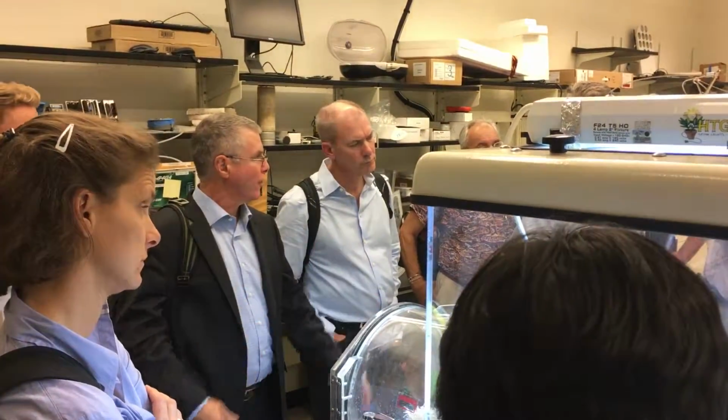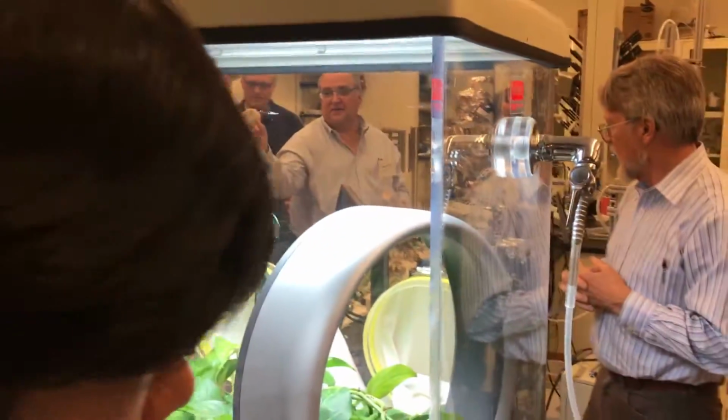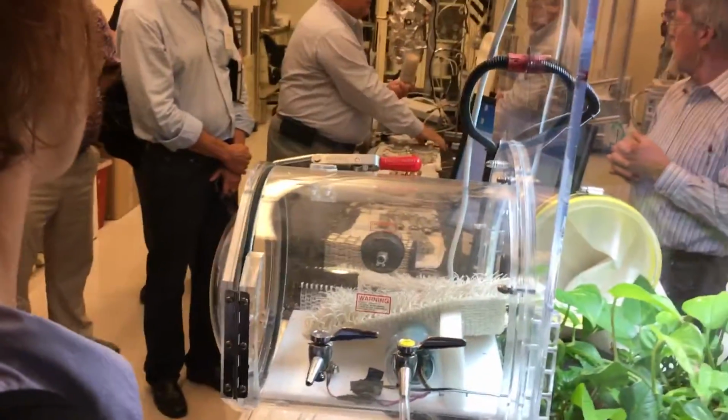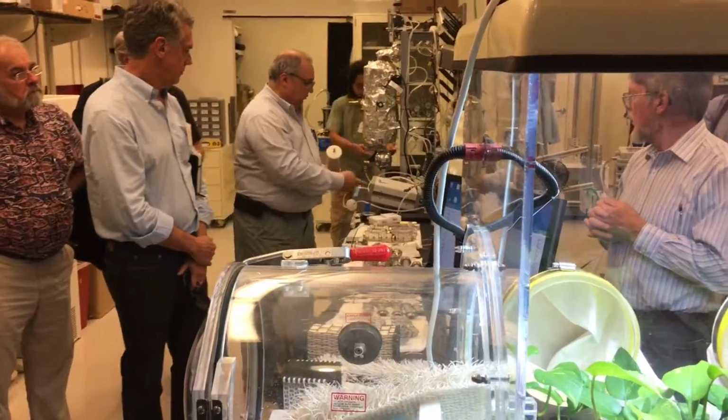Yeah, we'll show you that. This is a hockey puck of this, so in a much denser form than in there. So I'm going to put this in this tube, and we're going to flood it with water, and we'll measure it.